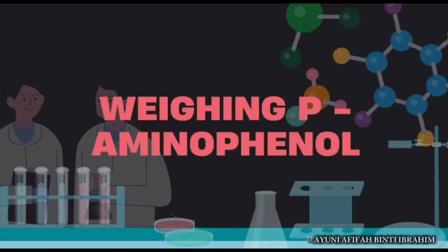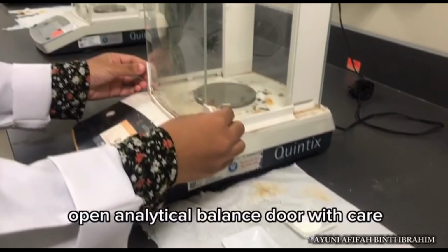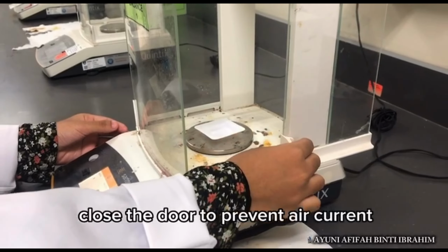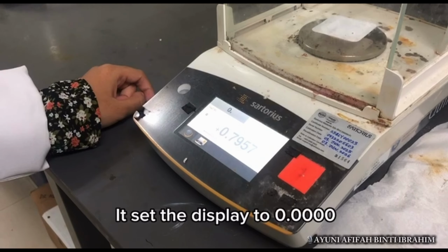Weighing p-aminophenol. Firstly, prepare weighing board, p-aminophenol and spatula. Open analytical balance door with care. Put empty weighing board on analytical balance pan. Close the door to prevent air current. Press the tare or 0 button. It sets the display to 0.0000.